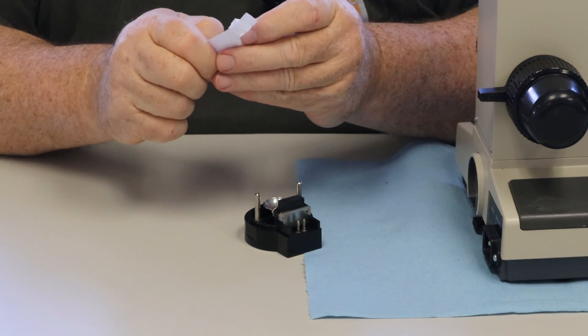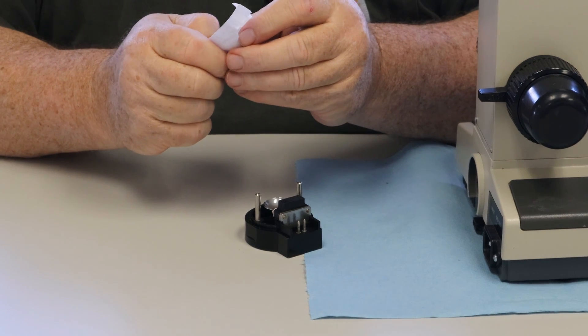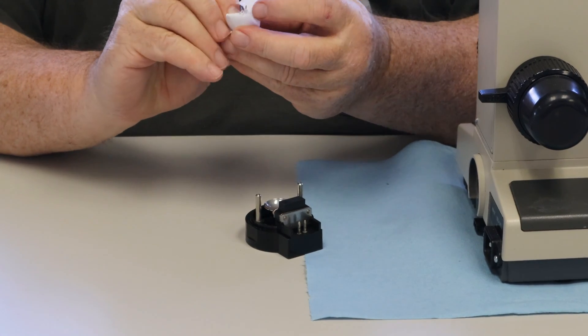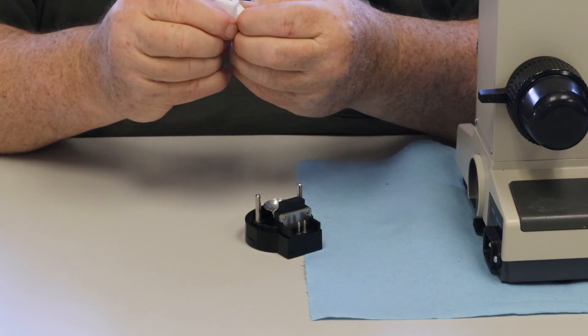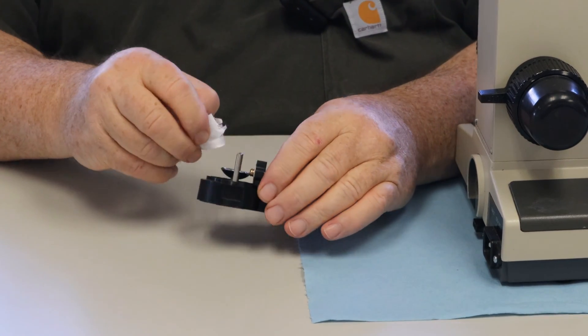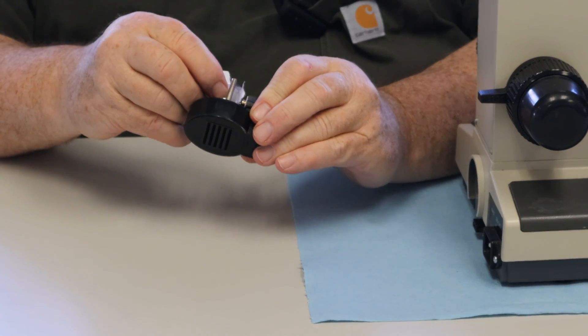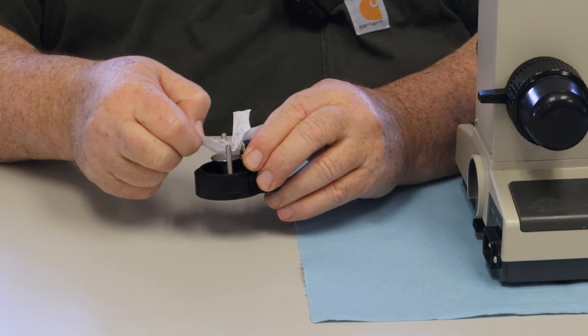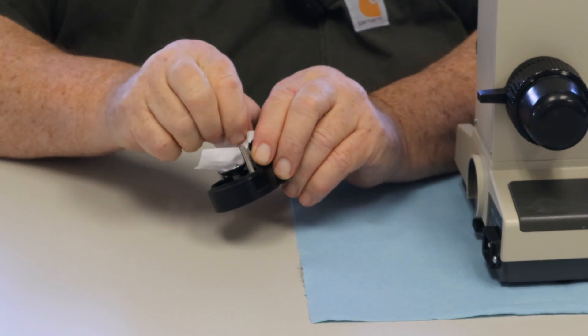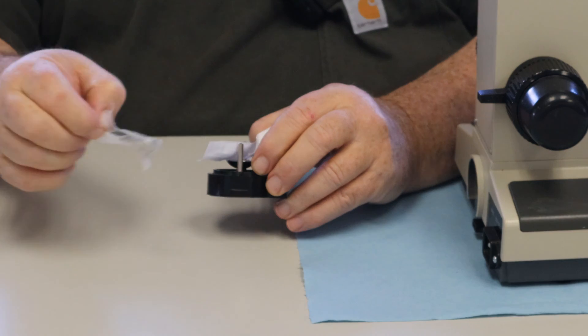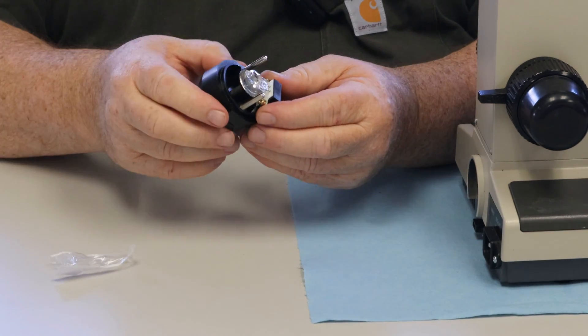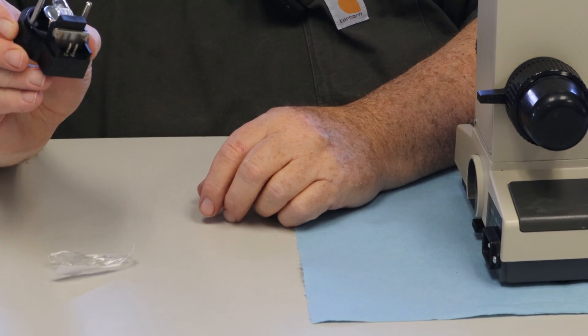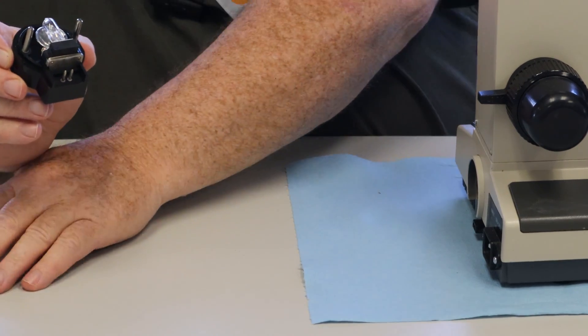Push the lamp bulb up, plug it in, and remove the plastic without touching the bulb at all. Therefore you have no reason to worry about getting your oily fingerprints on the bulb.